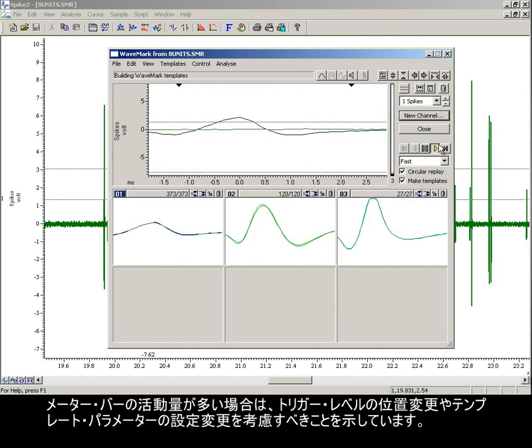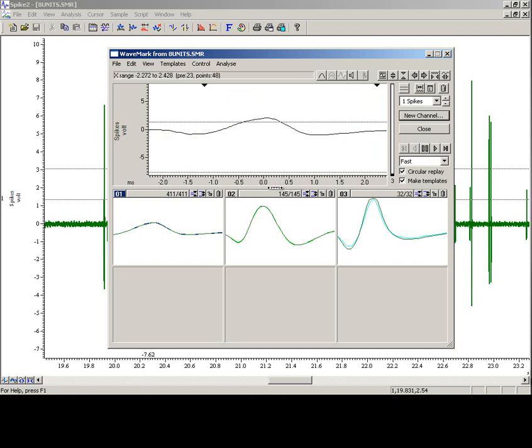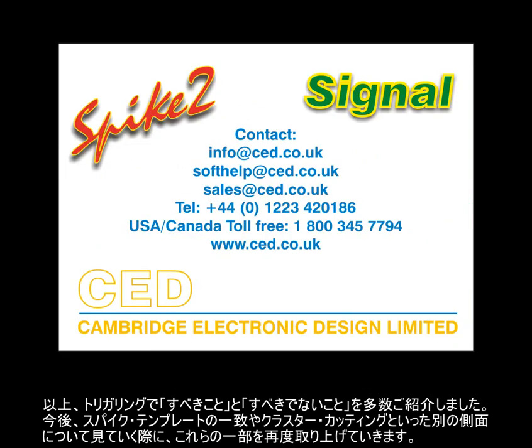A large amount of activity in the meter bar suggests we should consider repositioning the trigger levels and/or changing the template parameter settings. These settings determine how well a spike must match before it is considered the same class. That is it for many of the triggering do's and don'ts. We will revisit some of these in the future when investigating other aspects of spike template matching.